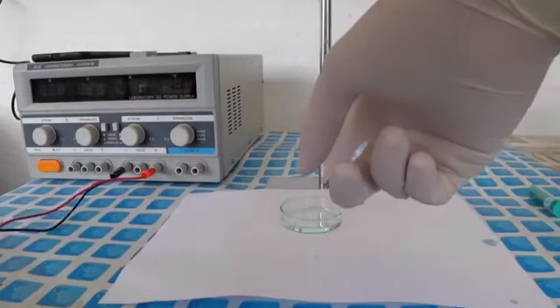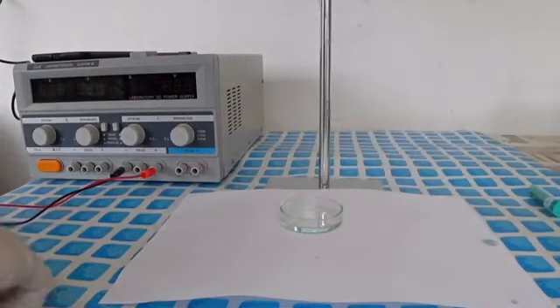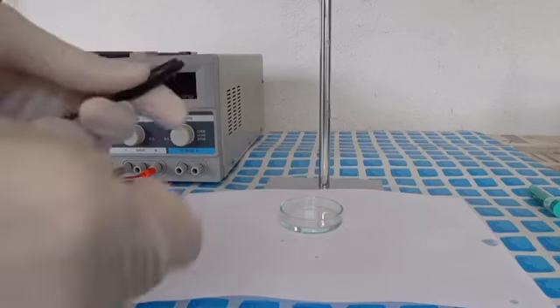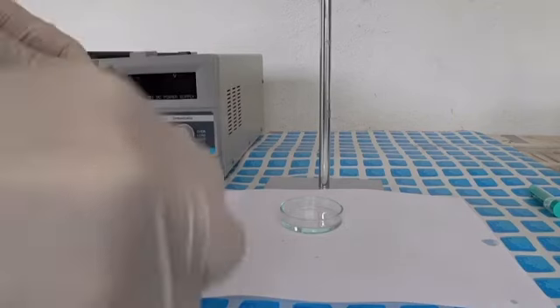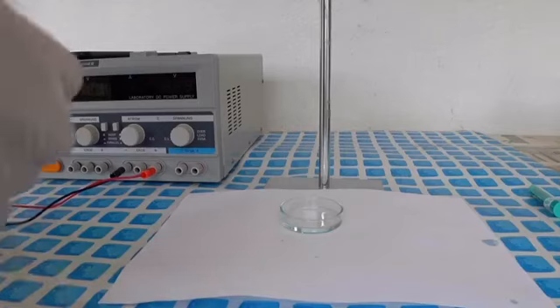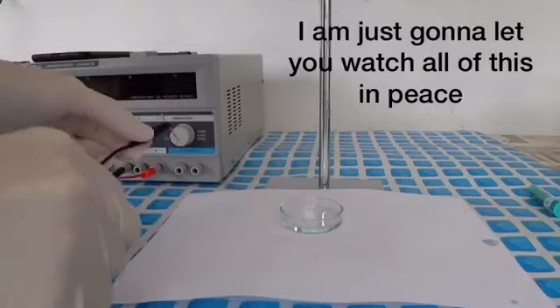I poured everything into this petri dish over here and I'm now going to connect two copper electrodes to our solution and let's see what happens.